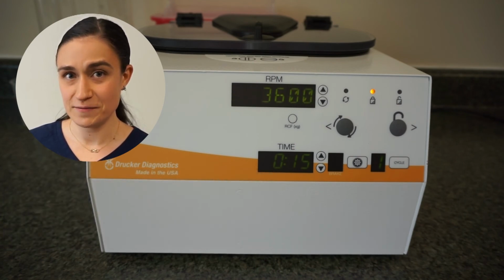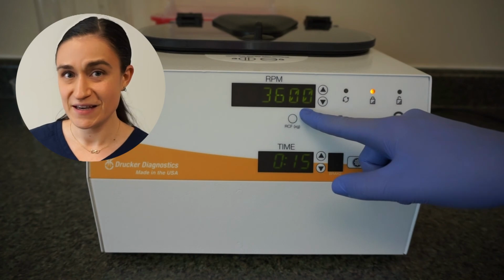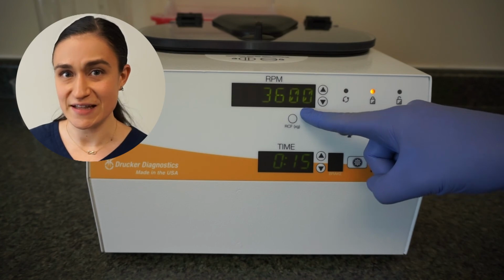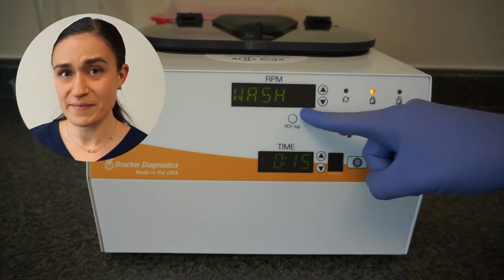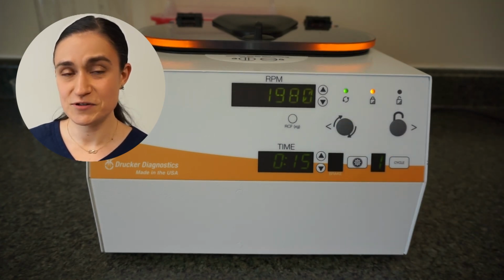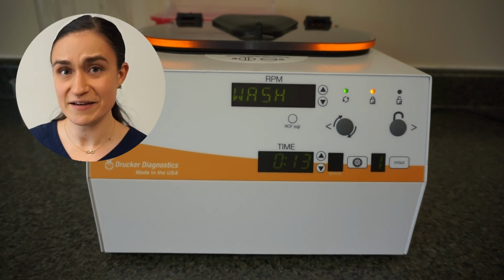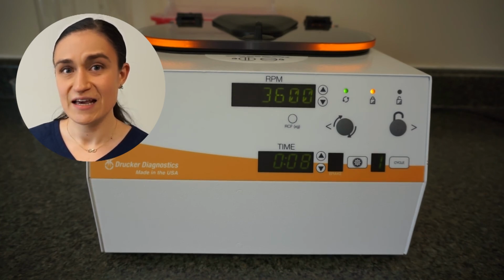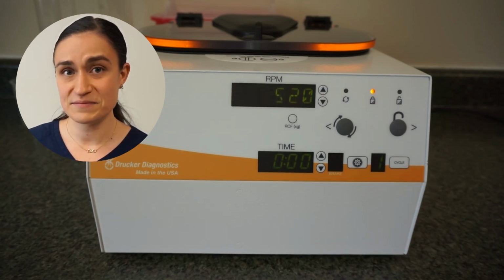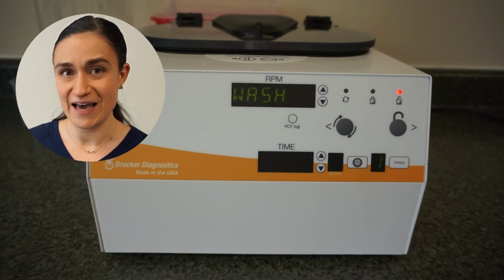Now, we'll make sure that we've got our new wash cycle selected. You can see the name up here in the RPM screen, alternating with that cycle selected RPM. Once we confirm that, we can run our cycle by pressing the start button. The centrifuge will spin up to the selected RPM for that cycle, and once it reaches that, it will count down until it reaches the selected time. At that point, it will slow down, applying the brake or not, as per your settings. And when it finally comes to a stop, it will beep and the lid lights will flash to let you know it's done.